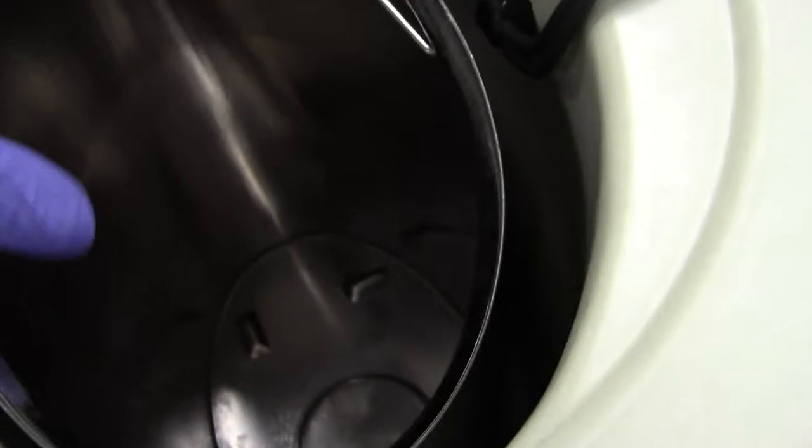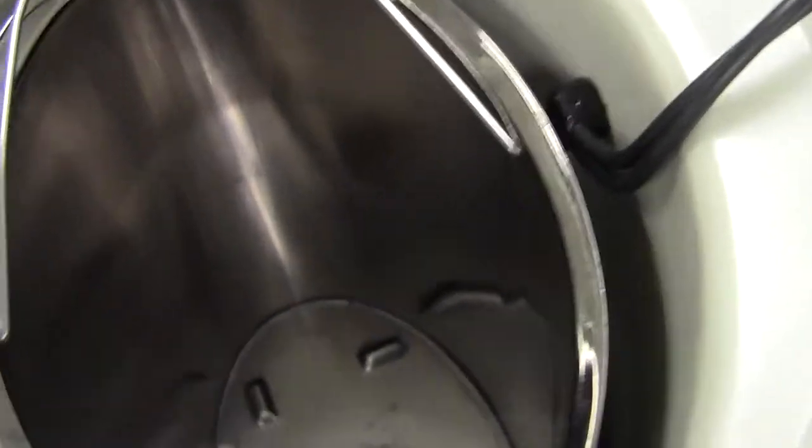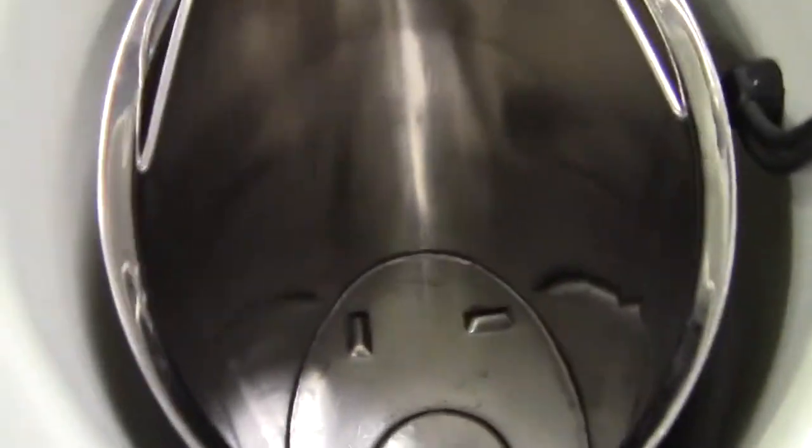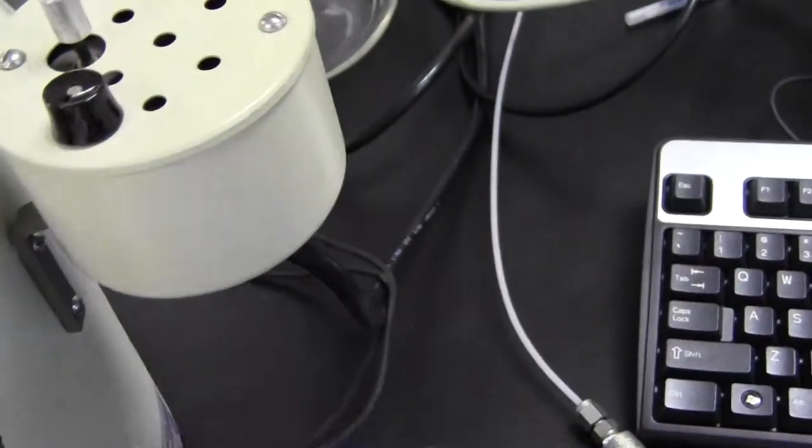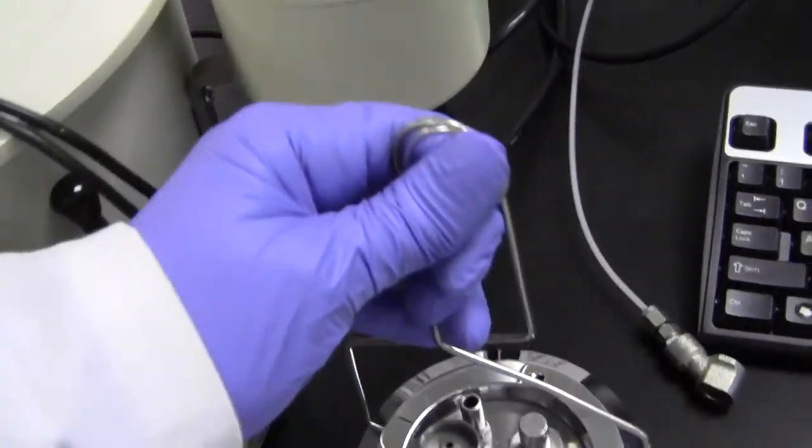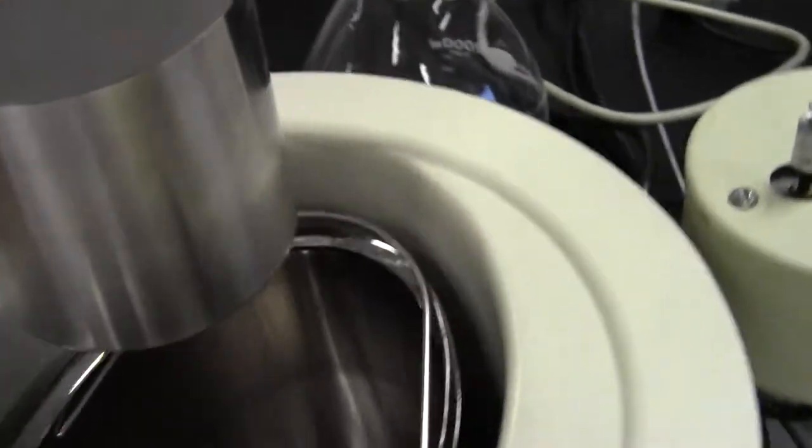So if this is already out, you see where those three bumps correspond to the three bumps on the calorimeter itself, and that's just to make sure that this is sitting properly. And then we'll place the bomb in. So we'll grab the bomb and we're going to make it sit right there on that circle.